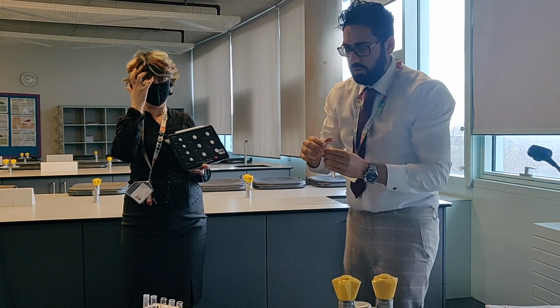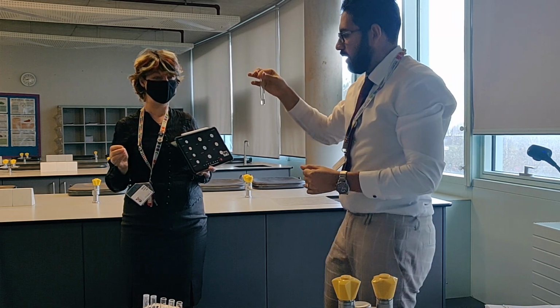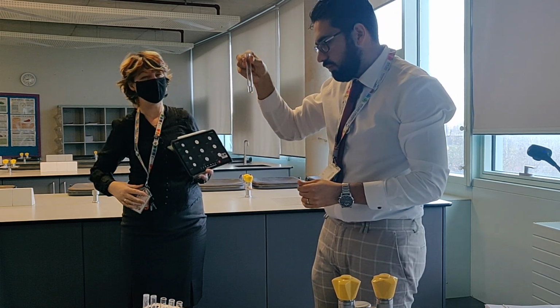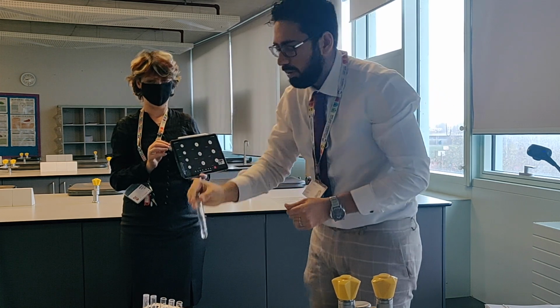Okay, what was that? Calcium bromide. Okay, so barely any change here. I think calcium sulfate is slightly soluble, slightly, but yeah, not much.